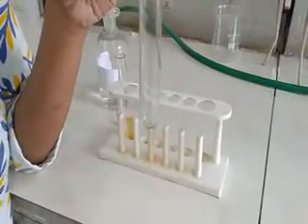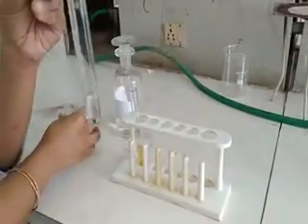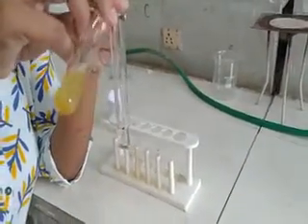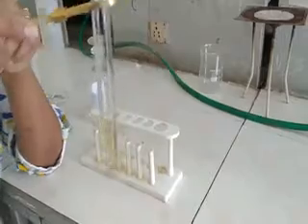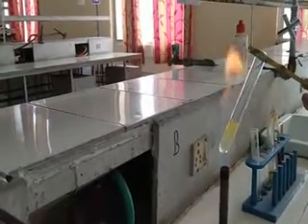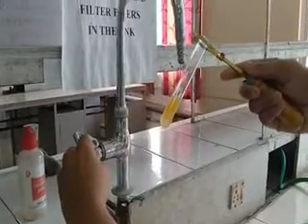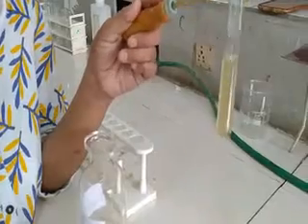Now we will carry out the test for nitrogen. For that, we will add 2 ml of Lassaigne filtrate in a test tube, then add freshly prepared ferrous sulfate solution and boil it. After boiling and cooling, we will add dilute sulfuric acid to the reaction mixture. As you can see, no Prussian blue coloration is observed, so we can confirm that the given organic sample does not contain nitrogen.